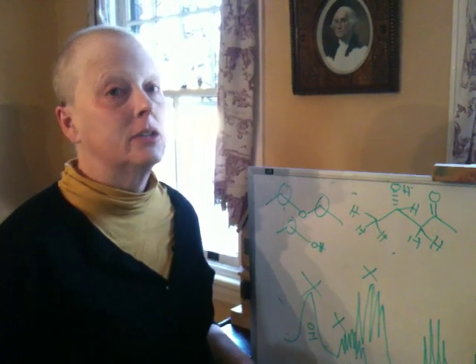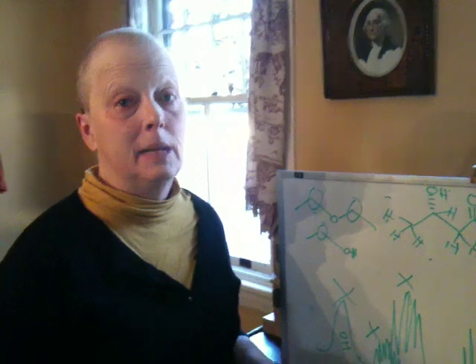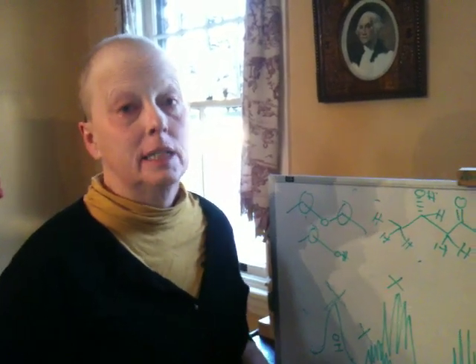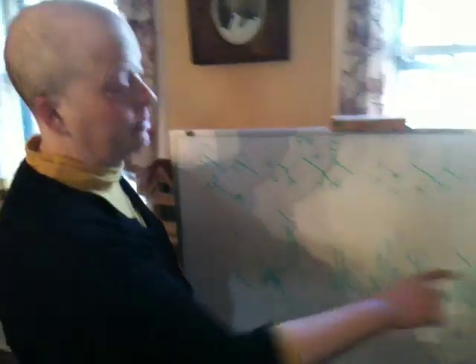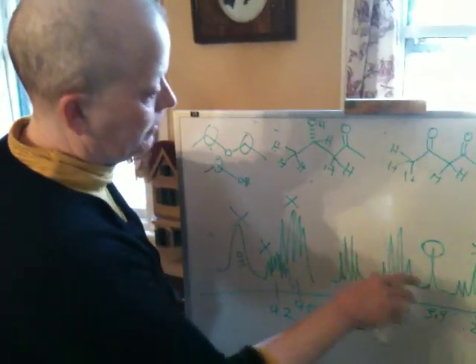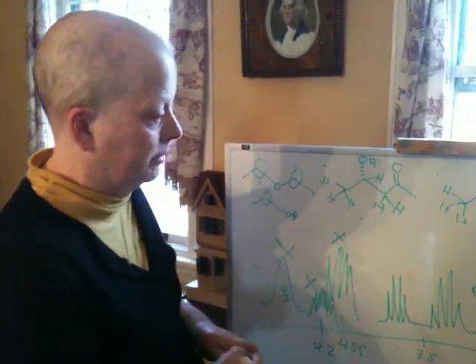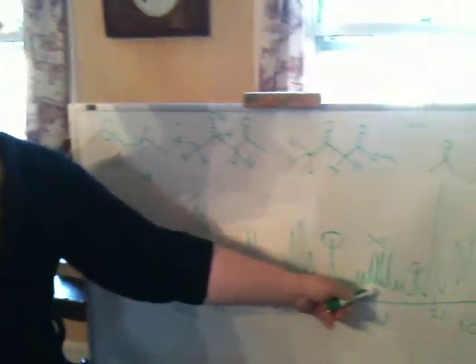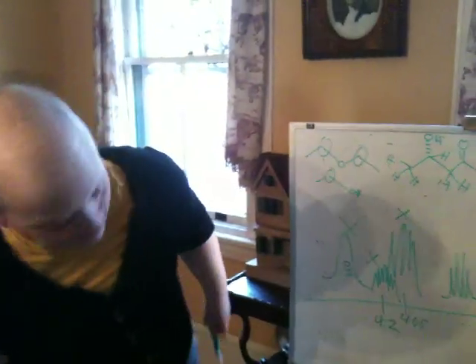The areas on these are not going to be very useful because this is a highly contaminated sample. I don't care what your IR looks like. It's highly contaminated. I tried on most of them to just integrate the relevant peaks, but in some of the spectra, everything's integrated, depending on who took the spectrum. I also tried to blow this up when I was running them with students. Now, let me get into the significance of that a little bit.